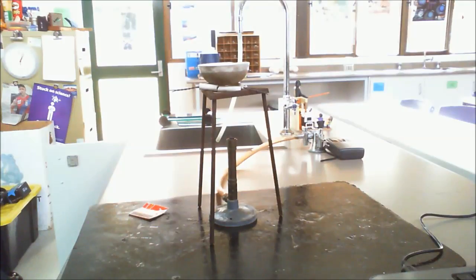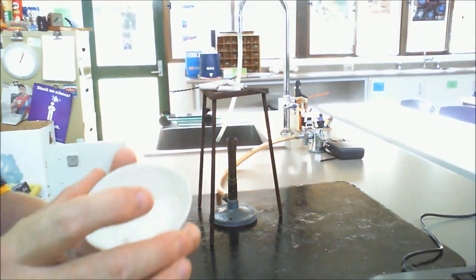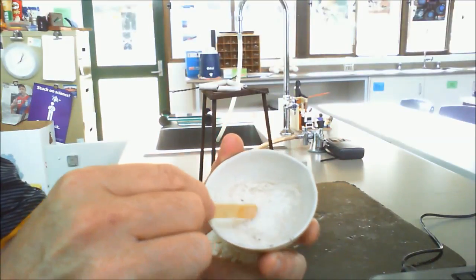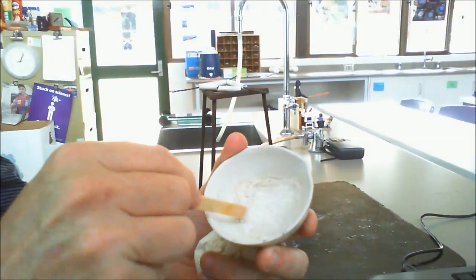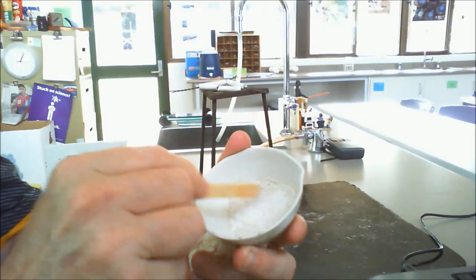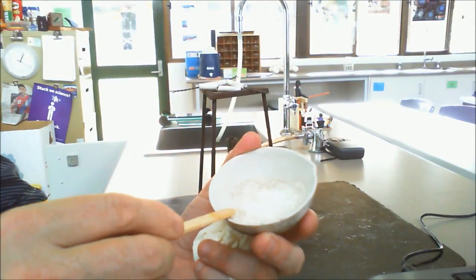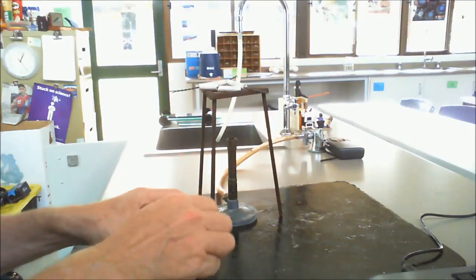Okay, so we've actually evaporated most of the liquid off, so we can see what we're basically left with, and you can see here now that what we are left with is in fact a white powder. Now again, chemistry is about repeating patterns, so the question is, what are we basically left with, and what could that be? So remember, we're looking for three things that are produced from an acid carbonate reaction.